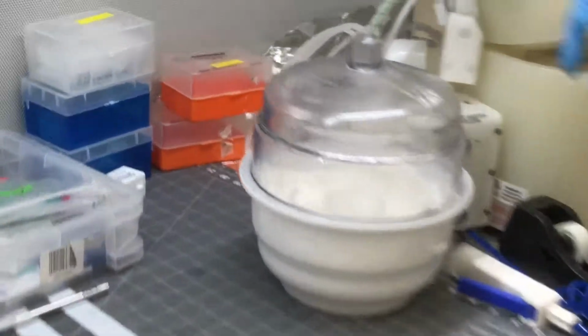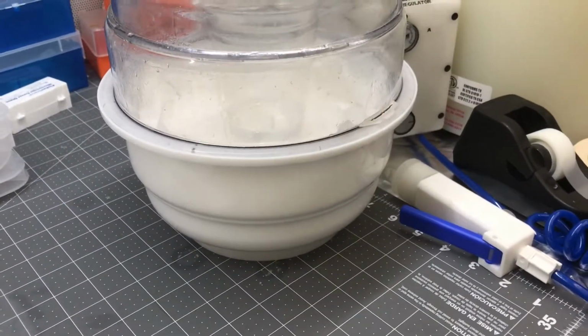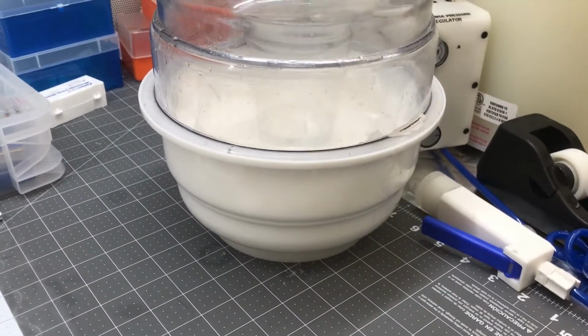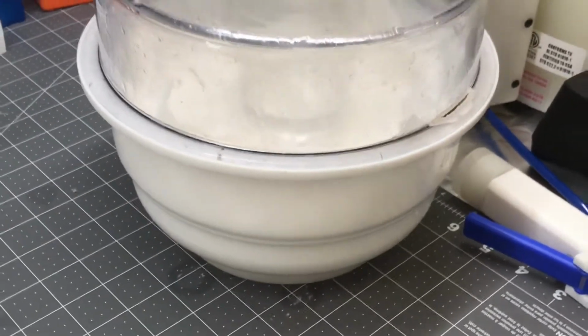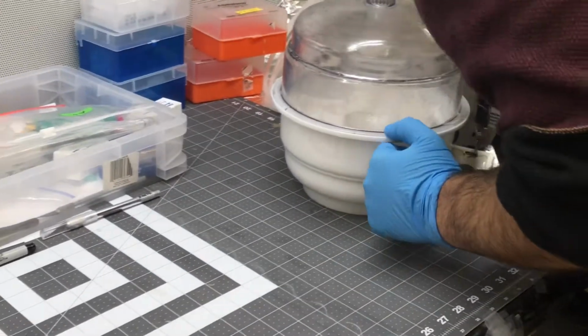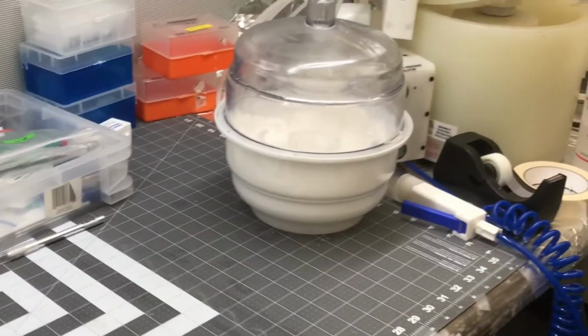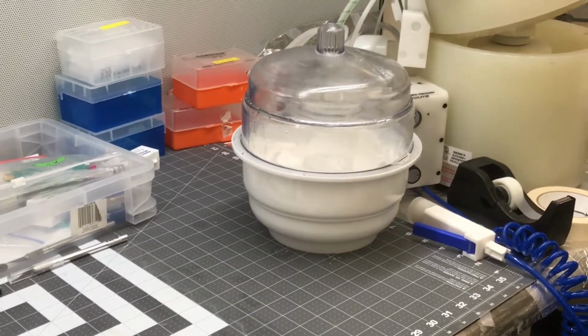So now I show this part. You see it's completely bubble free, all transparent. I see no bubble, although it is not showing very well. It is not showing because this is a glass barrier. So when you take it out, I'll zoom in. So you are saying that the PDMS plus curing agent mixture is now completely free from bubbles.